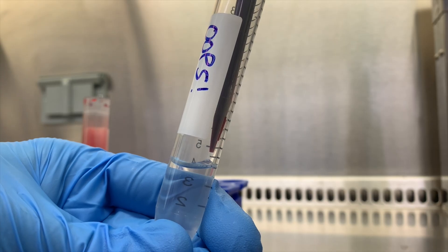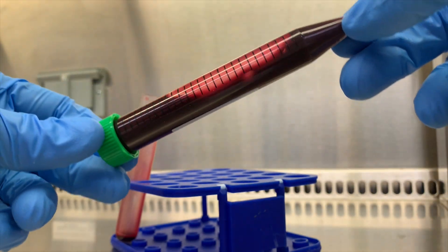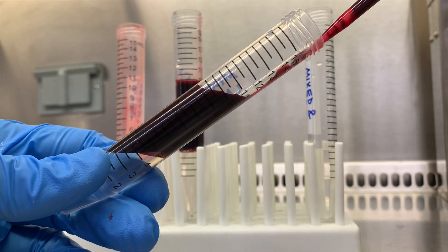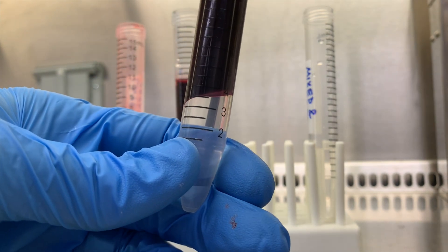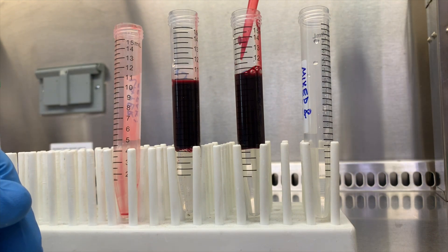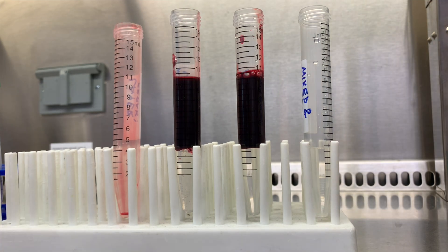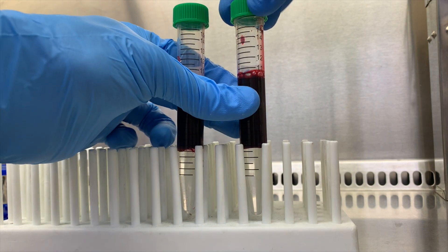The first problem I'll cover is breaking the layer between the blood and the Ficoll. If you're lucky, you'll have enough blood to just restart, but if not, you can do something a little unexpected — just mix your sample into the Ficoll until it's homogenous. Now you can layer that mixture onto Ficoll again, probably splitting it into another tube or so just to fit that extra volume, and then centrifuge them on the Ficoll settings for 30 minutes and proceed as usual. You can use the same recovery technique if you take your Ficoll out of the 30-minute spin and happen to drop or mix it unintentionally and lose your layers — just mix it all together again and re-layer it onto Ficoll. You're essentially starting over. If you want a better separation, you can dilute the mixture of blood and Ficoll one-to-one by volume with either PBS or cell culture medium before re-layering onto fresh Ficoll. The only issue with having to re-layer is your plasma layer will now be mixed with Ficoll, PBS, or media, so you can't really use the plasma for downstream studies since it'll be diluted with other reagents.